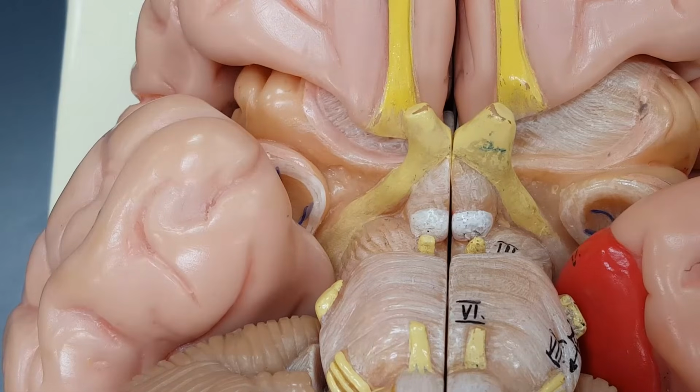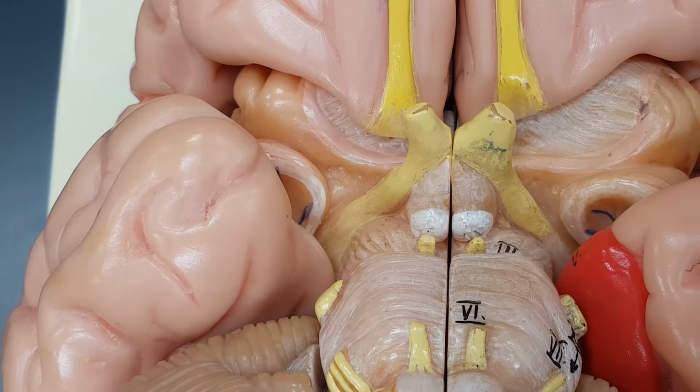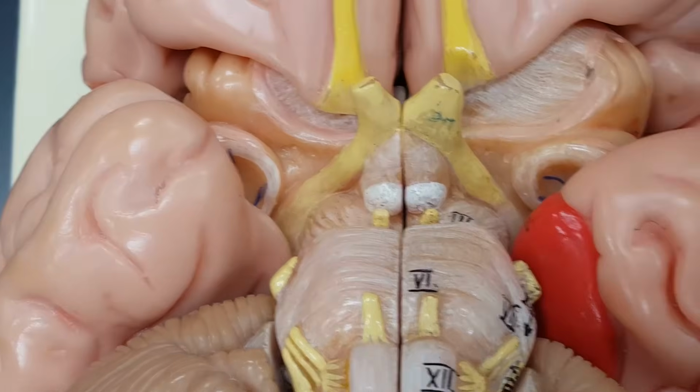One, they're white, they stand out. These are little clusters of neuron bodies that have to do with odoriferous reflexes and potentially memory having to do with smell.